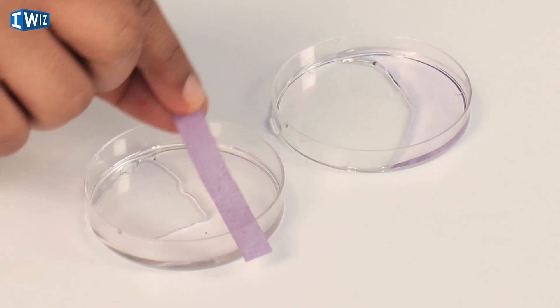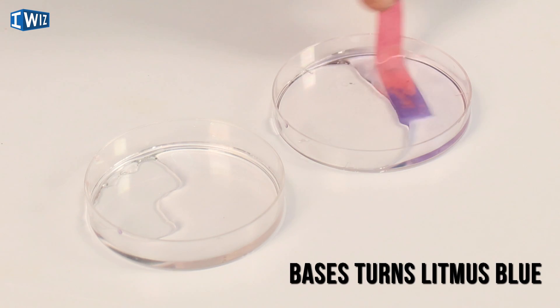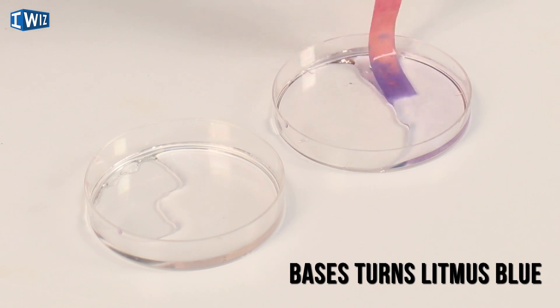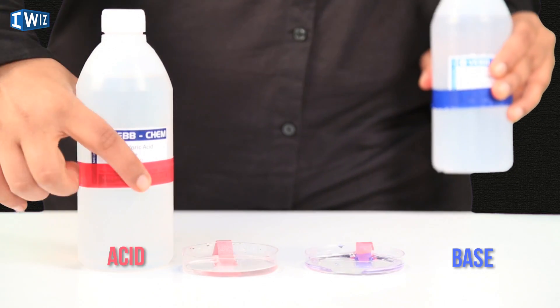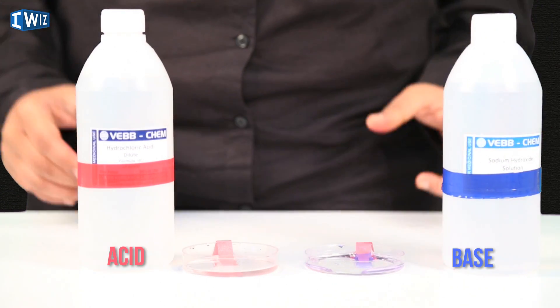The most common indicator you must have heard of is litmus. We have blue litmus and red litmus. Blue litmus, when put in an acid, turns red; and red litmus, when put in a base, turns blue. I'm going to keep the acid over here — the red color symbolizes that blue litmus turns red — and the base over here, and we're going to try out some other indicators.